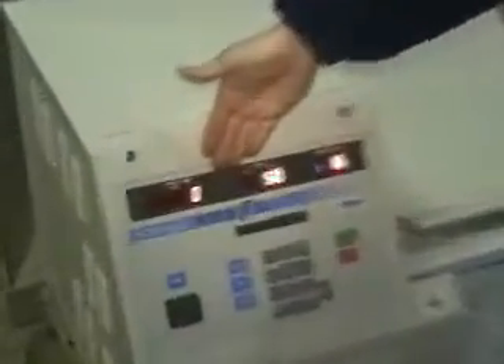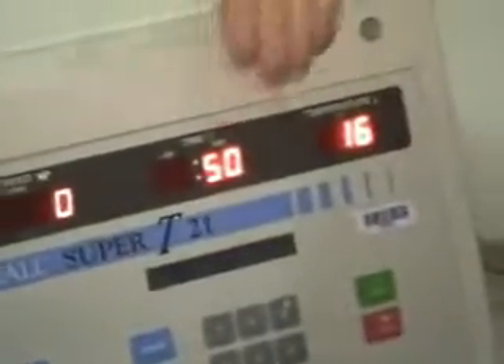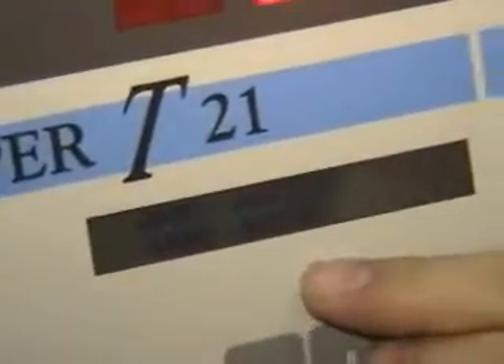On the top, we have the speed, time, current, temperature. Here, this little LCD over here, that's where your set point is. You've got the 4,000 RPM, the time, and we have it going down to 4 degrees refrigeration.